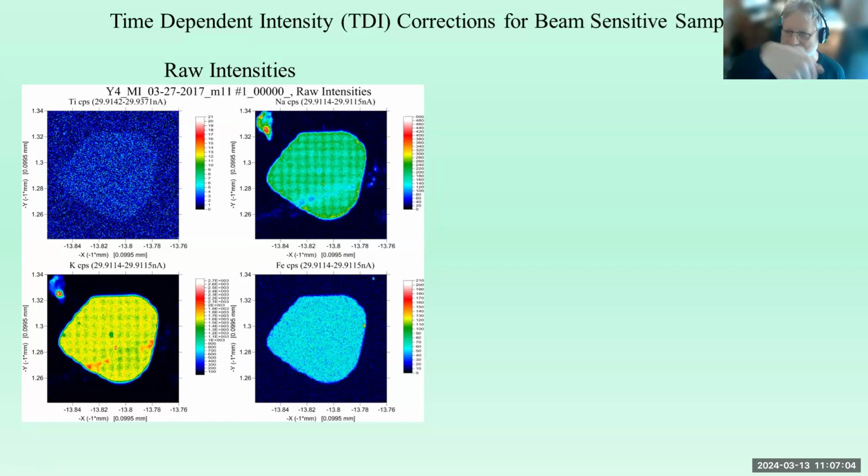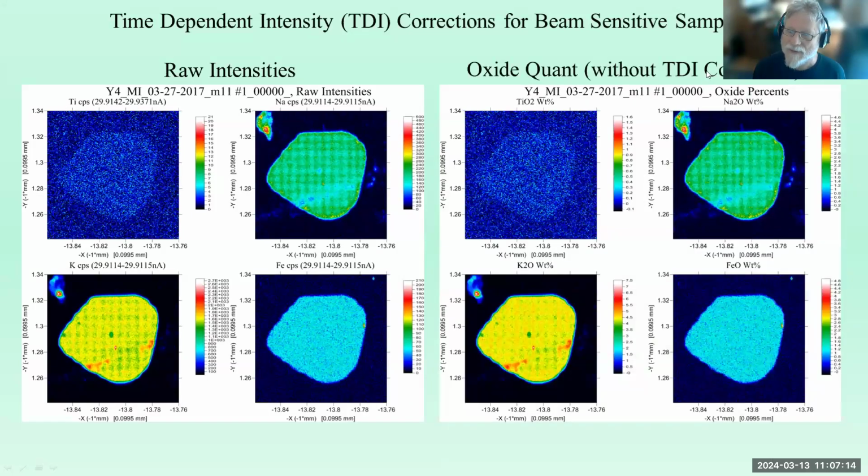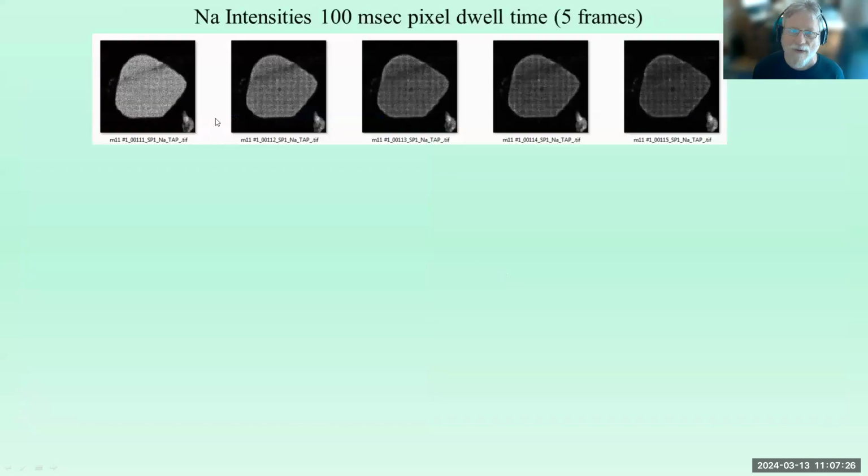It has to do with the way the ions migrate while the beam is moving. You can imagine the beam is moving and dragging along some alkalis because of that subsurface charge that is moving under the surface. And if we quantify it without the TDI correction, you can see that we still get the same pattern here, even though it's quantified. And it's true for the potassium and the sodium. This was kind of a serendipitous thing, but there was a sample here that was not beam sensitive in the corner.